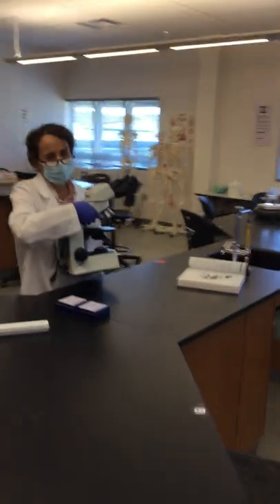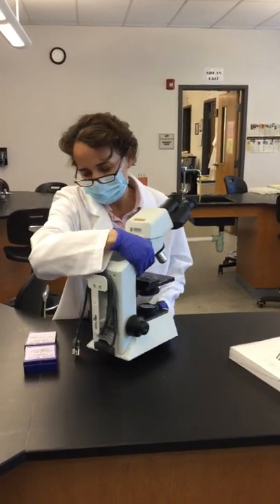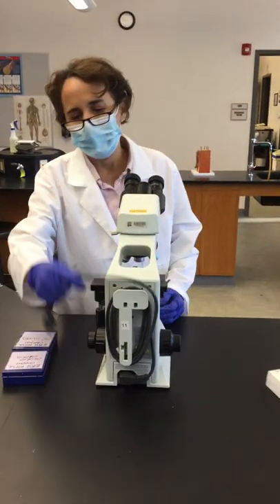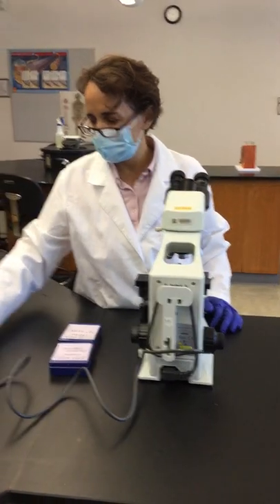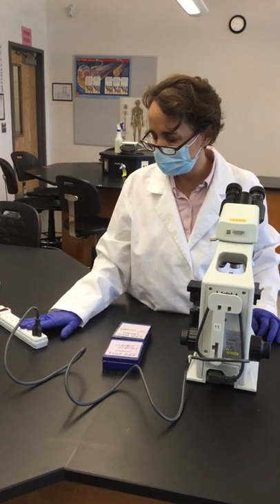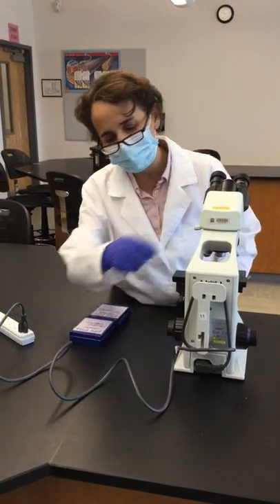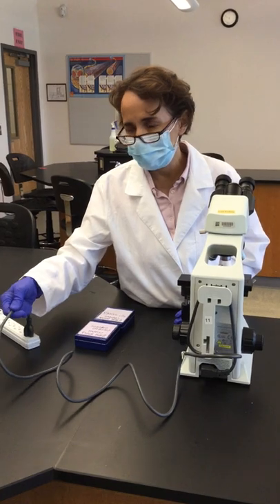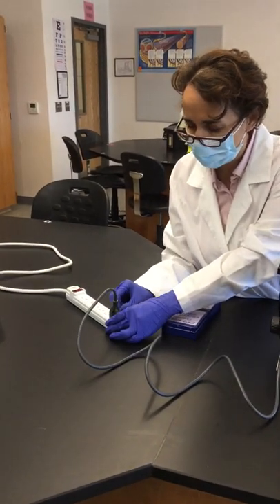When placing it on the countertop, never let it fall — be gentle. Place it about four to five inches from the edge. This is the cable that provides the electrical supply; connect it to your outlet. When you're done, unplug it and wrap the cord neatly. Never pull it from the cord itself — always pull from the base plug that goes into the outlet.